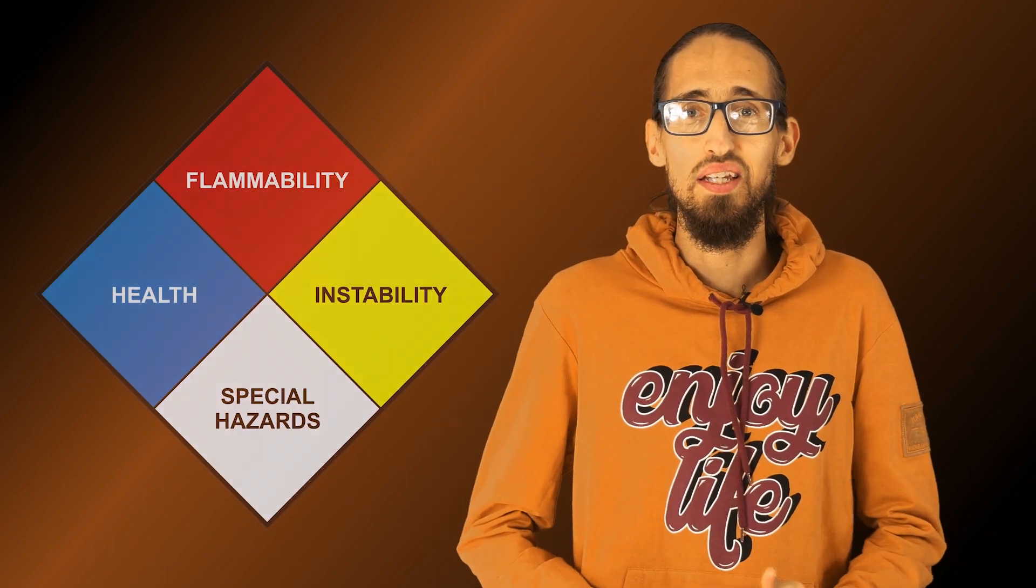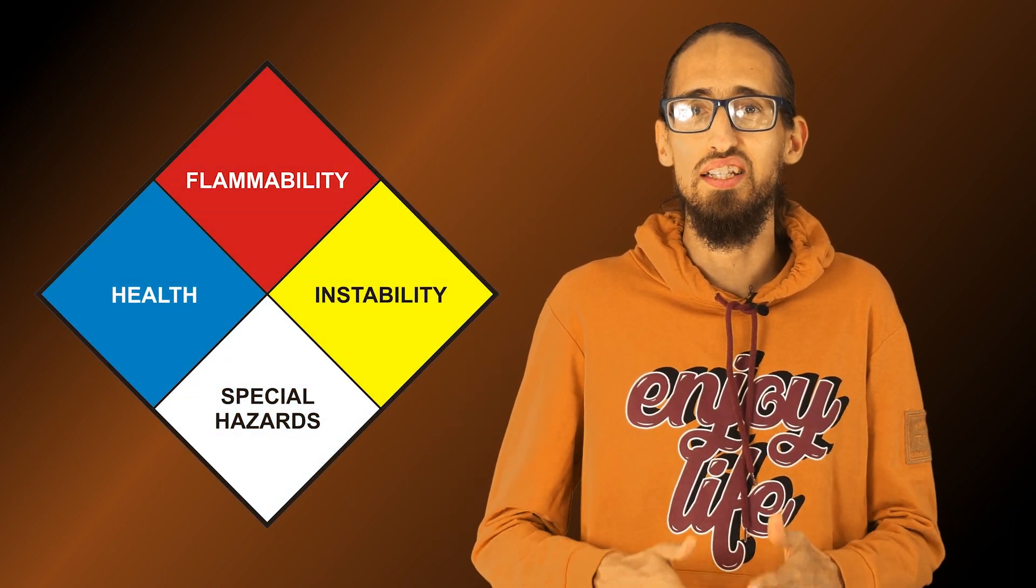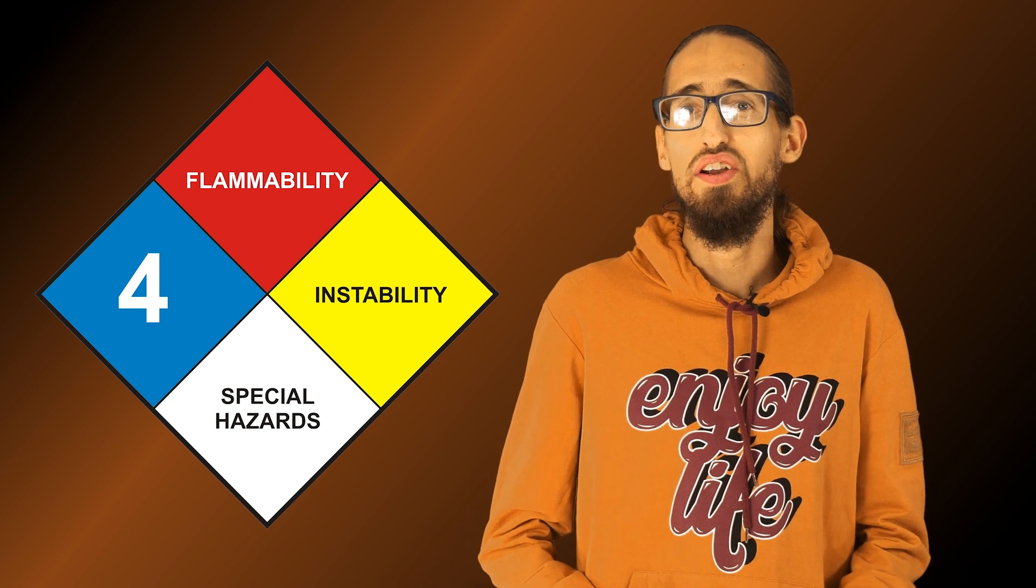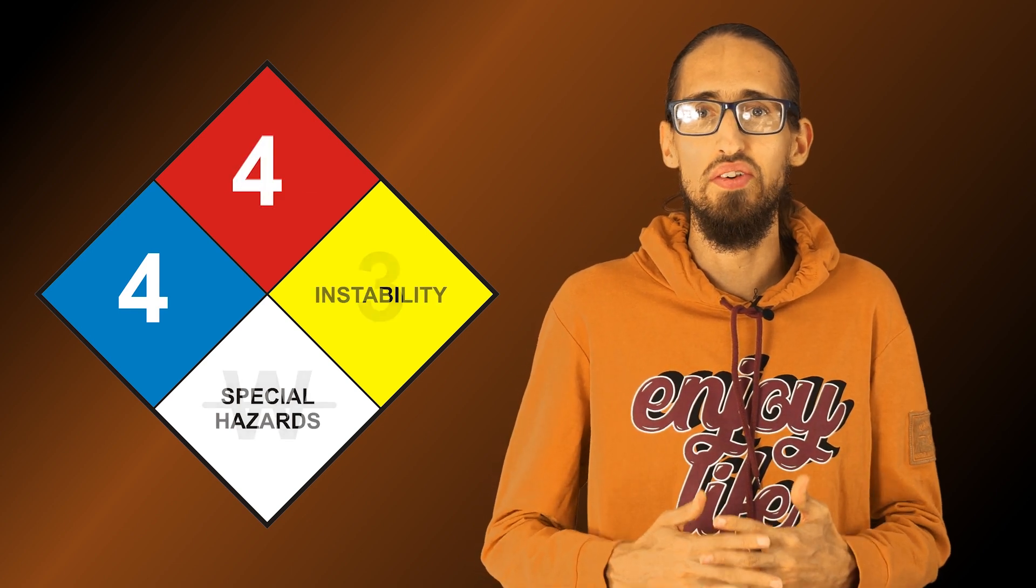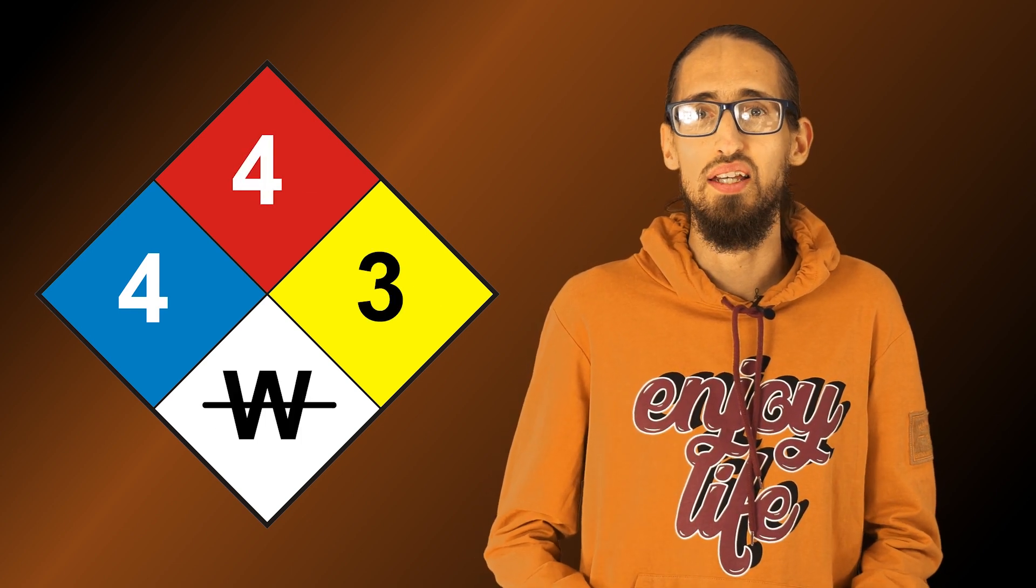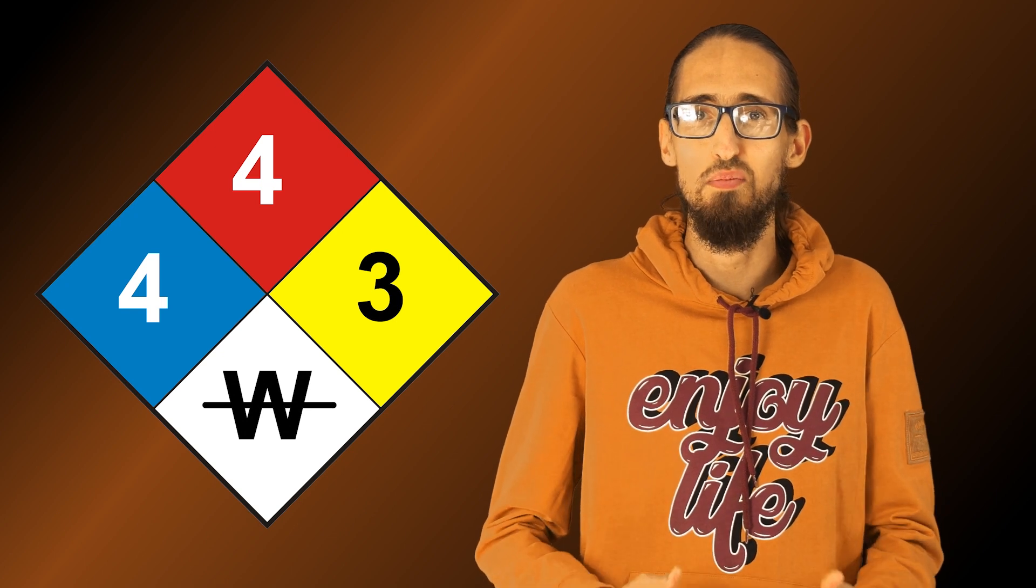Hello guys! Our today's chemical compound is a very highly toxic gas, very hazardous and extremely reactive. It, as you probably got from the video's name, is diborane.